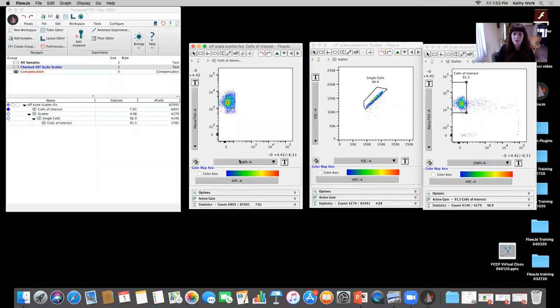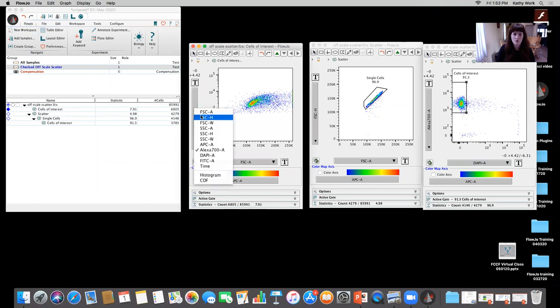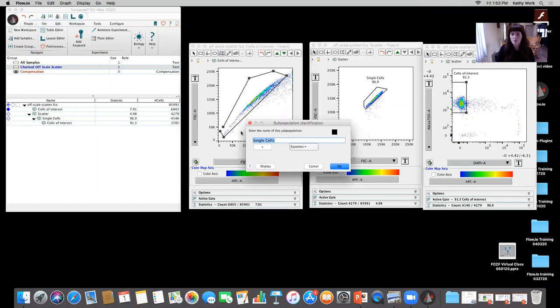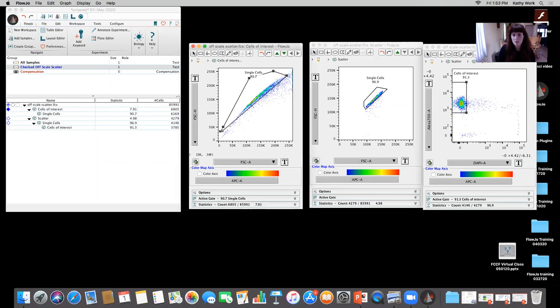Double click, open up. I'm going to do forward scatter area versus height. Okay, I'm going to be a little bit more broad with this scatter gating, or with the singlet gating rather. But most of my cells are really right about there. This is a pretty good singlet gate, and we could always do doublet exclusion as well. But for the sake of time, not doing that today, I'm gonna double click there, and then I'm gonna look at forward scatter and side scatter.